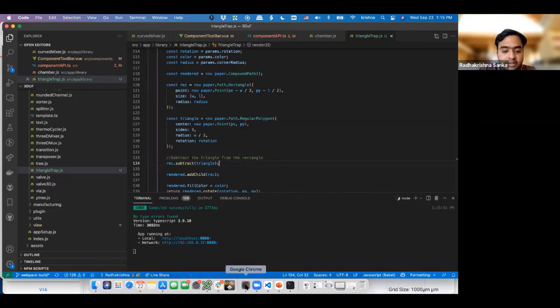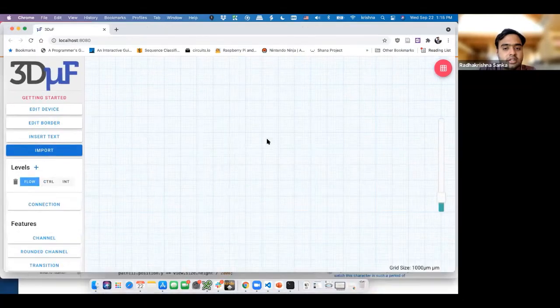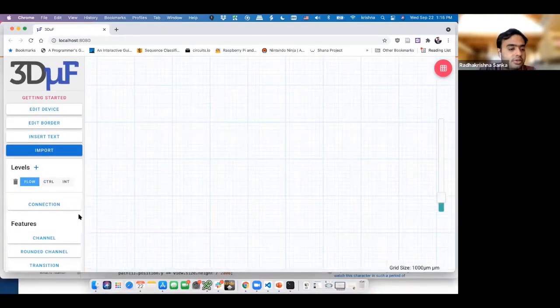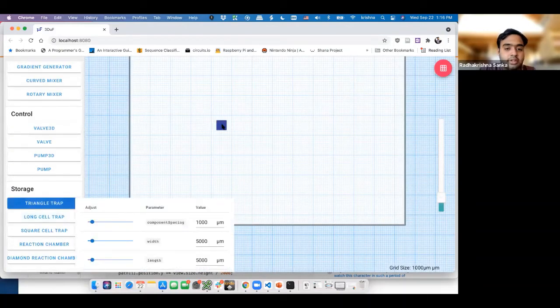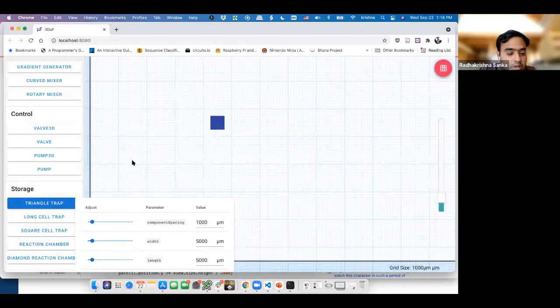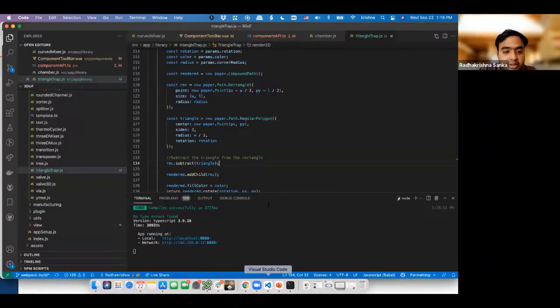Let's see what we get in here. Reload. So zoom out a little so that it's not messed up. Triangle trap. And right. Well, that did not work. Let's go back over here. So let's say we took out this one, just to check whether or not it's working correctly.